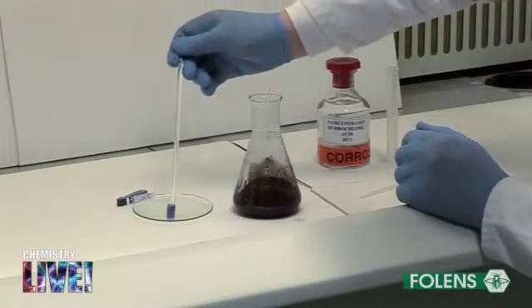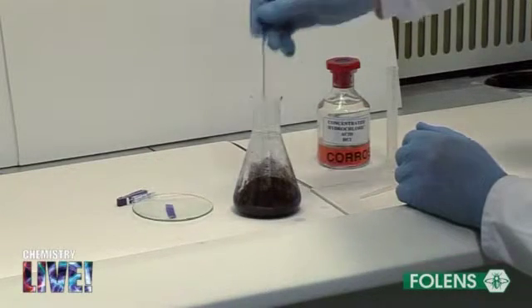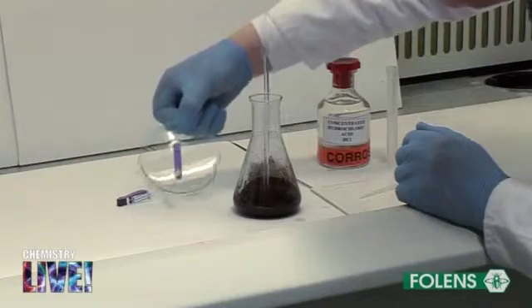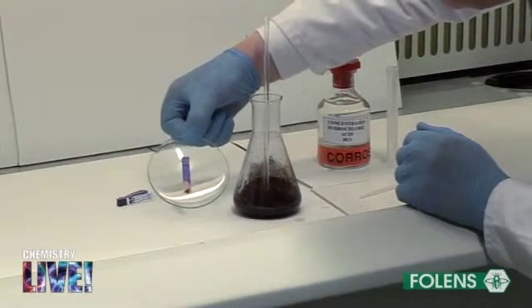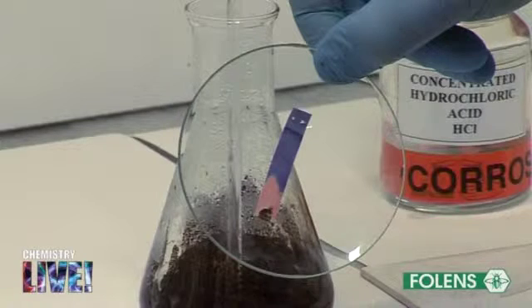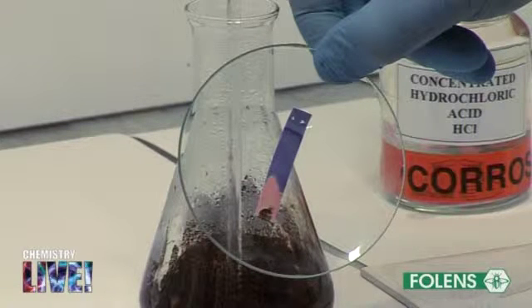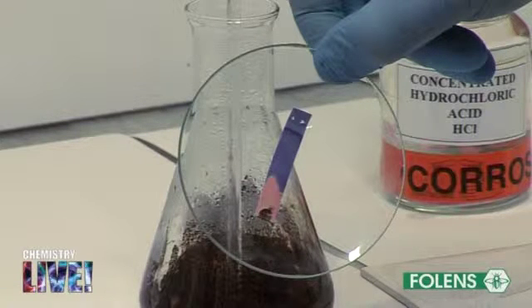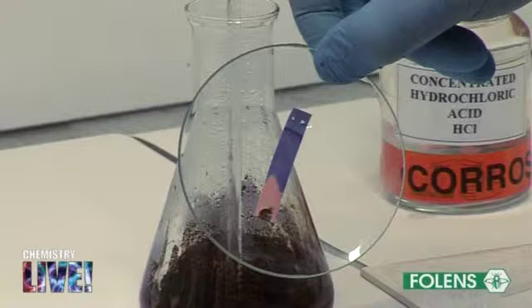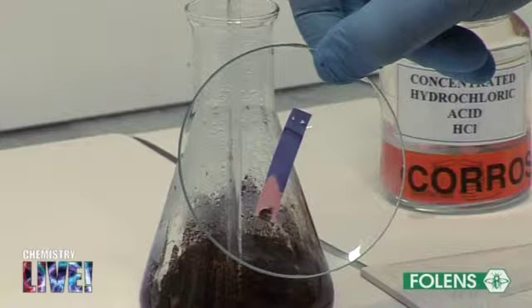When all the HCl has been added, a glass rod is dipped into the conical flask and the end of the glass rod is touched against a piece of damp blue litmus paper. This is done to check that the contents of the flask are acidic — that is, the blue litmus paper turns red. The stirring rod is left in the conical flask to avoid loss of yield of benzoic acid.